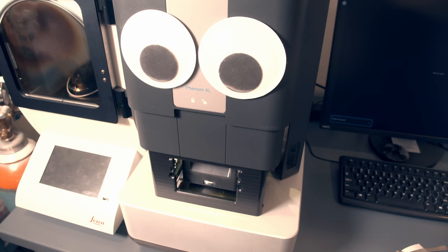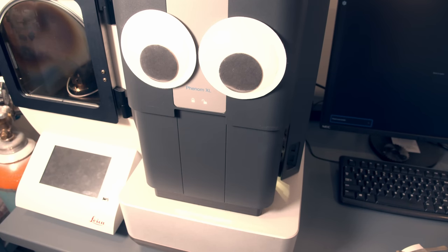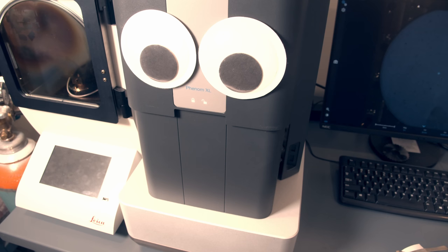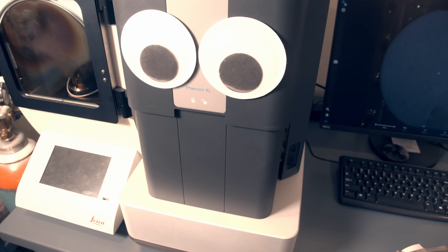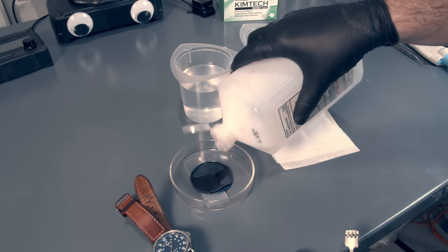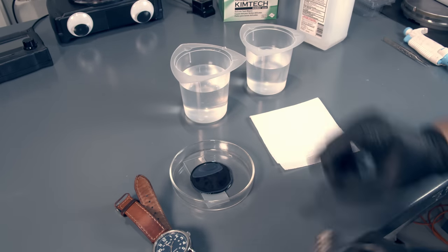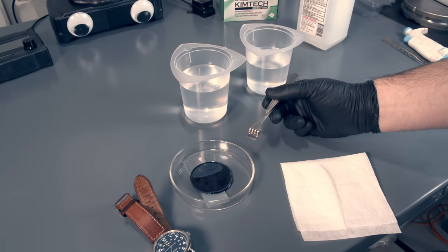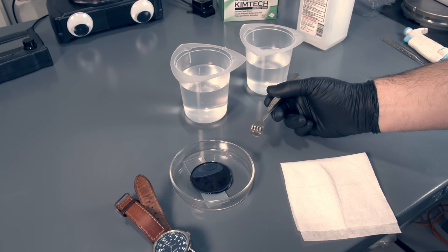Unfortunately there's nothing to see of the E-beam process itself — you put the sample inside the machine, it pumps down the vacuum, and rasters the pattern. My machine has a convenient Python API to command it to move to different locations, change beam settings, and raster out a pattern. The next step after pulling it out of the SEM is to develop it: I use ice-cold 70% IPA, develop for 30 to 45 seconds, then rinse in deionized water, and if everything's gone well, you have a pattern.